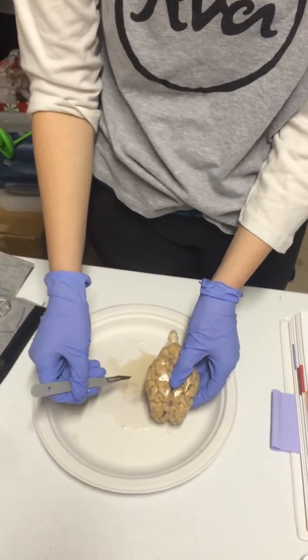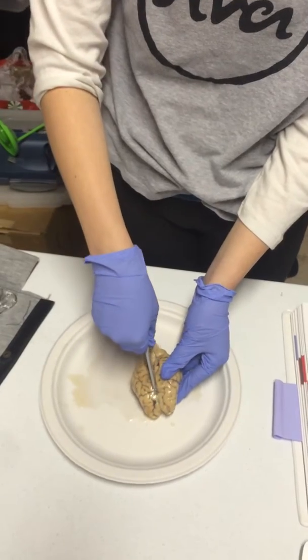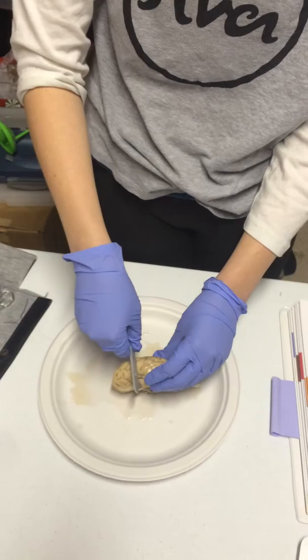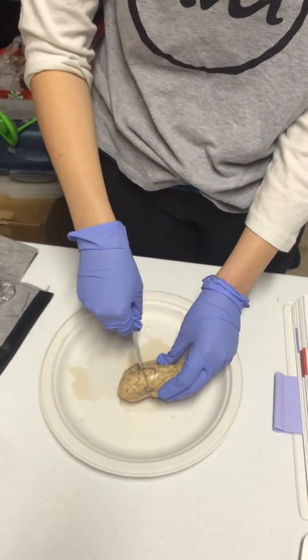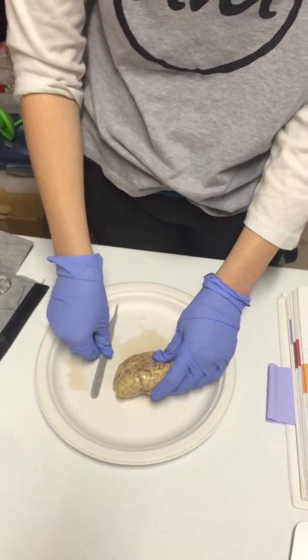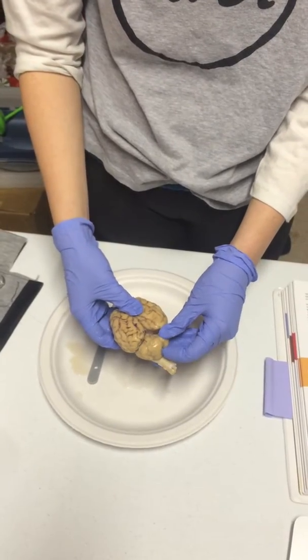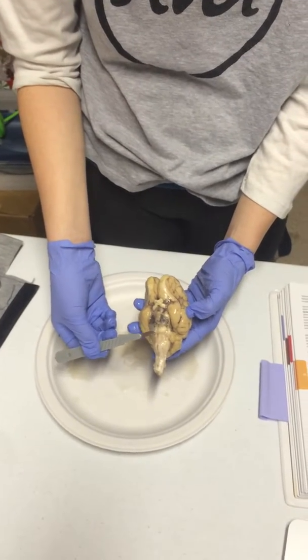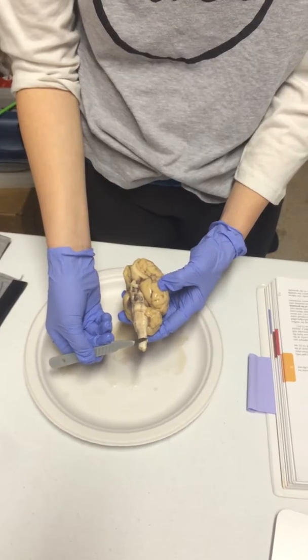We also have a longitudinal fissure, which is right here, that's going to separate the brain into 2 hemispheres. Right here on the side we have our lateral fissure coming right up here, and that's going to separate the temporal lobe and the parietal lobe. So then we're going to have the cerebellum, which is right here on the back. We're going to have the pons, which is here, and then our medulla oblongata. And then this projection right here is actually our spinal cord.